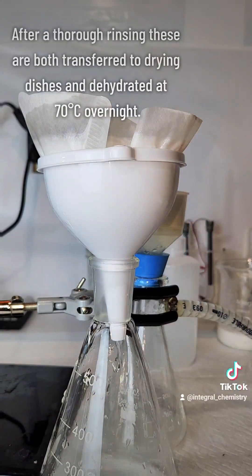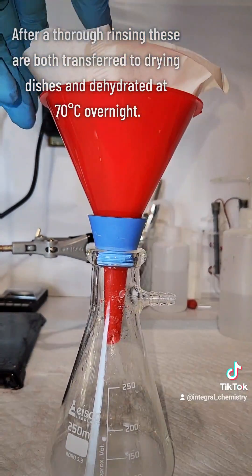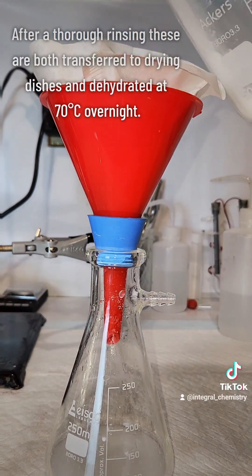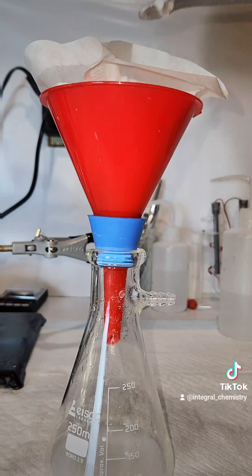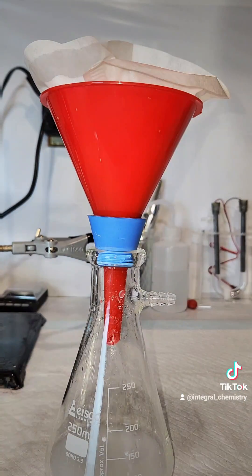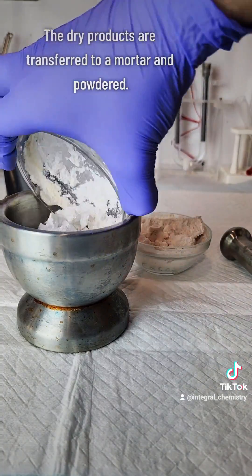These are both rinsed very thoroughly to get rid of any residual sodium chloride. They're then both transferred to drying dishes and dried at 70 degrees Celsius overnight. The resulting dry masses of salt are transferred to a mortar and powdered thoroughly.